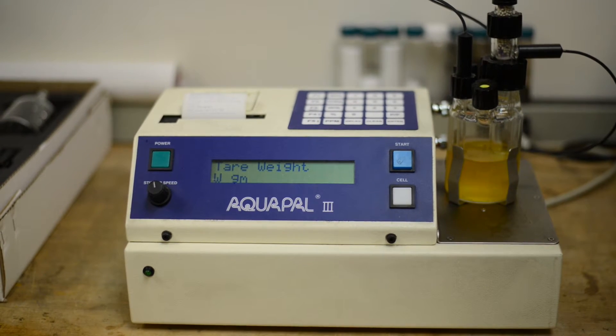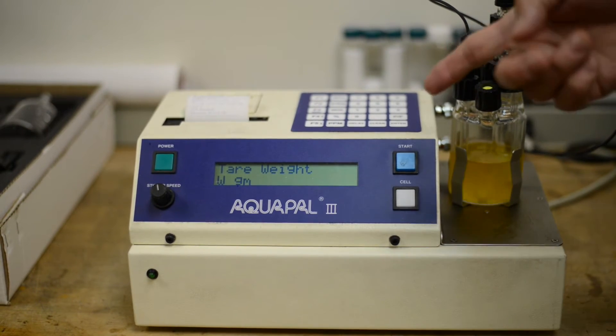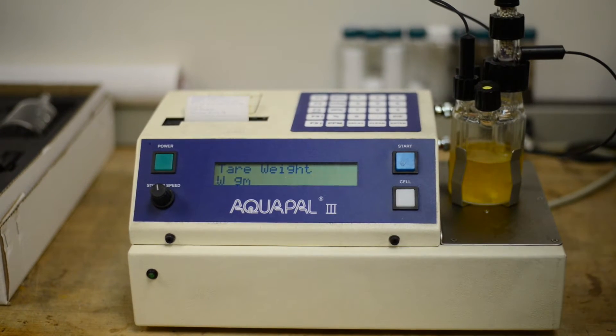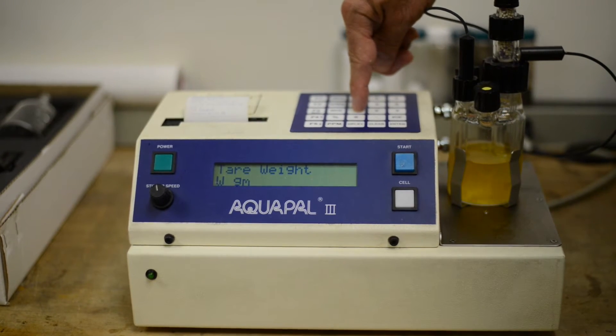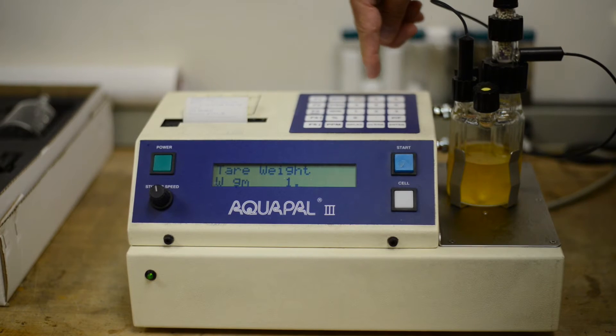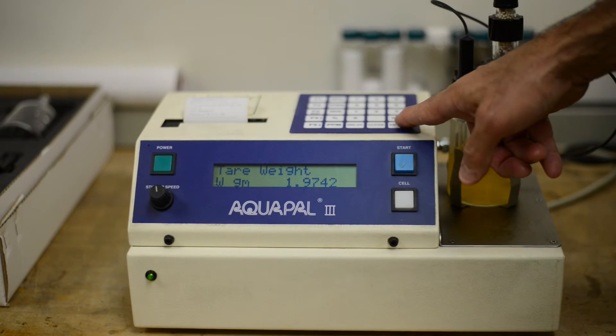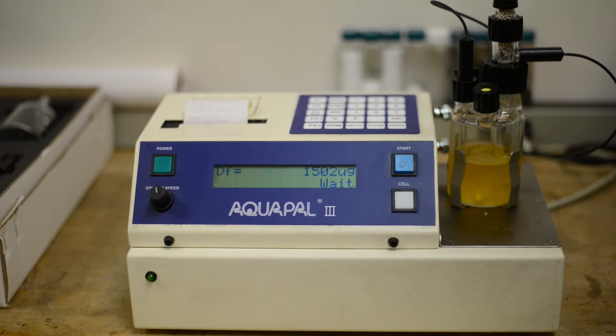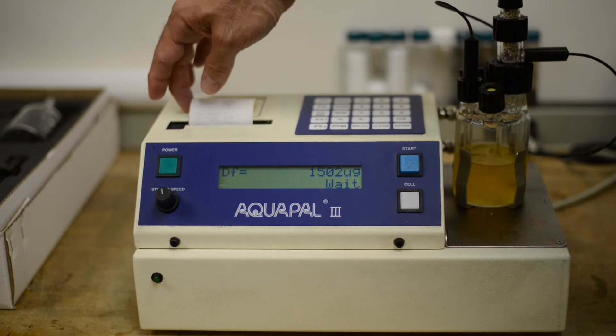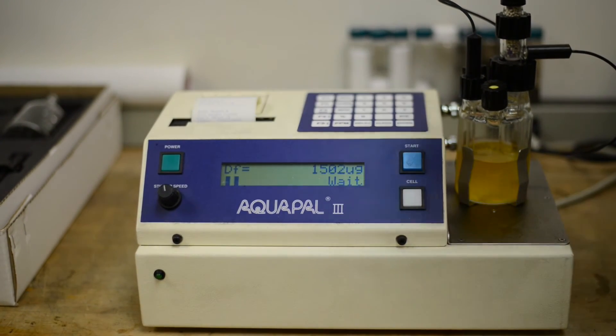Okay, so now the test has ended. It's taken about, oh, I'd say a minute and a half. And it's asking for the tare weight. So the test is finished. And based upon the weight on our scale, we're going to enter that number. So we're going to put in, it's asking for the tare weight. So 1.9742. And we'll hit the enter button. And there we go. So we have a result. And the test is finished. And we have a result. And it's that simple.